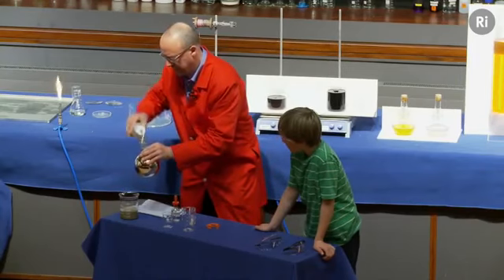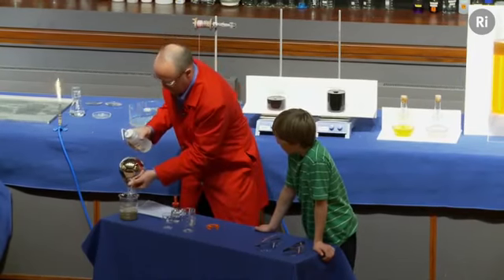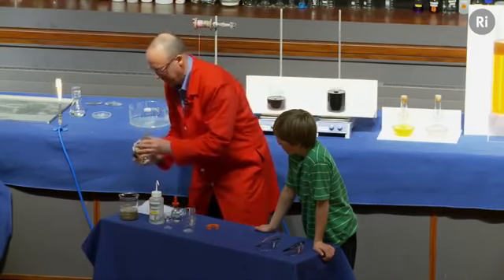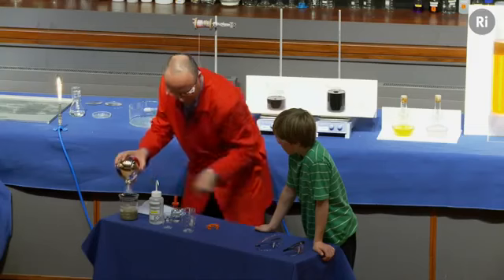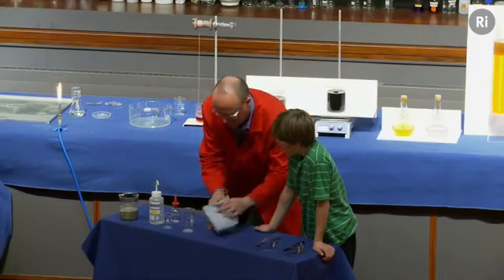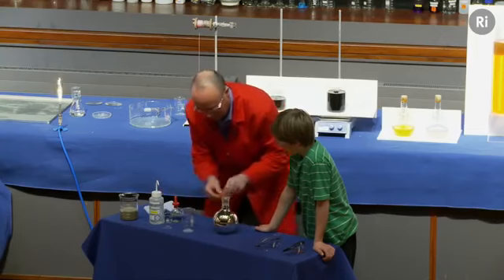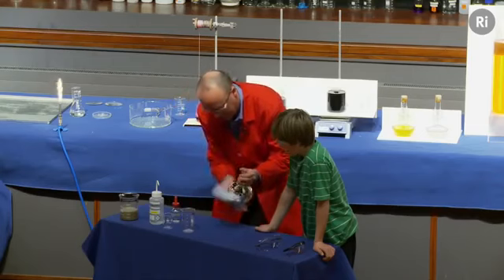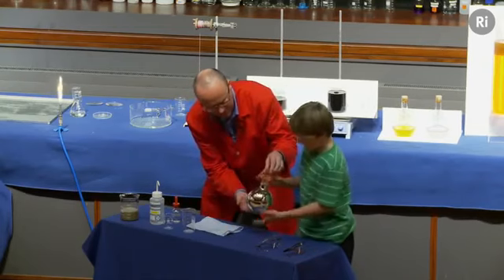I'm going to rinse it out a second time. Rinse it out a third time. There we go. And I'm just going to dry this off, and put the clip back on. And if you'd like to just give that a little polish. There we go. If you'd like to hold it up by the neck, that's it.